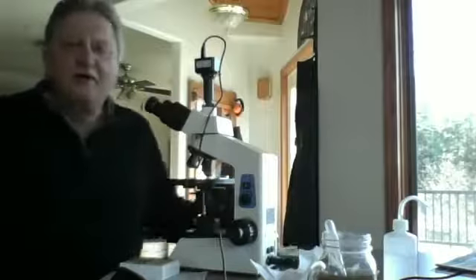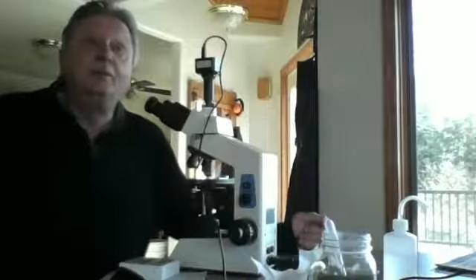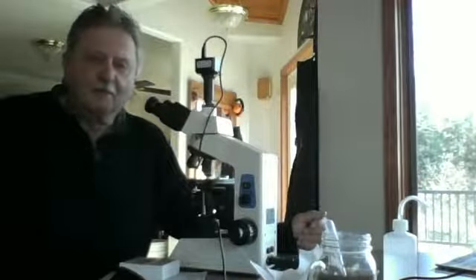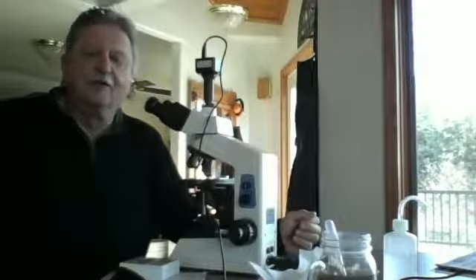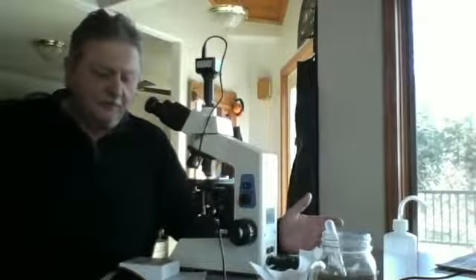Today, it's March 18th, 2022. The homework assignment for CLP session number 8, which is finished with 7, is to provide, as I recall, a main assessment only, narrated by me, Greg Stack, with soil or tea of my choice, narrating just the first reading area of 5 fields of view, and then going through the rest of the fields of view on the other 4 reading areas. And that is apparently without narration.